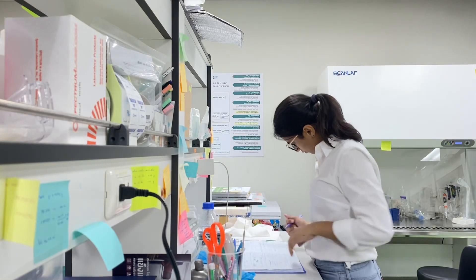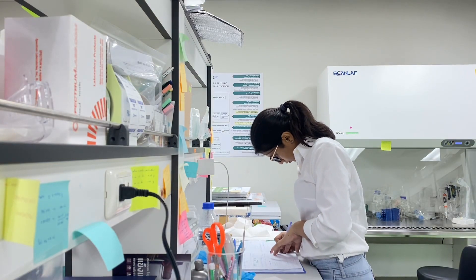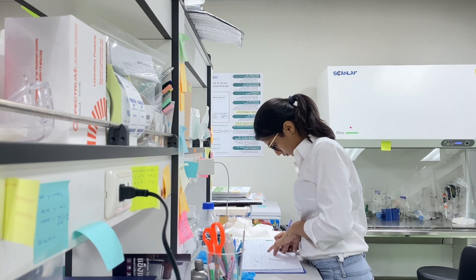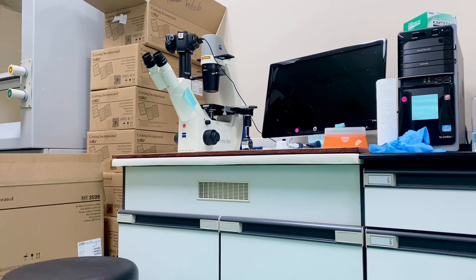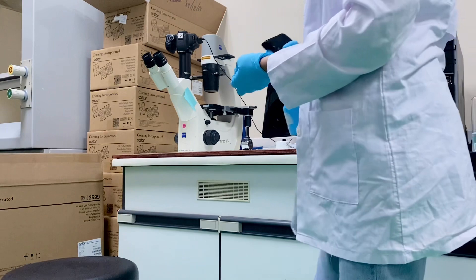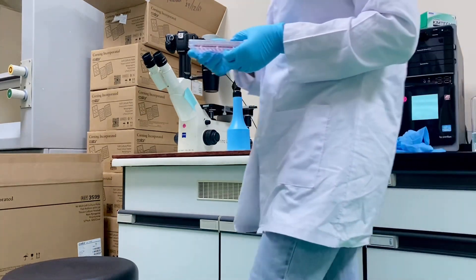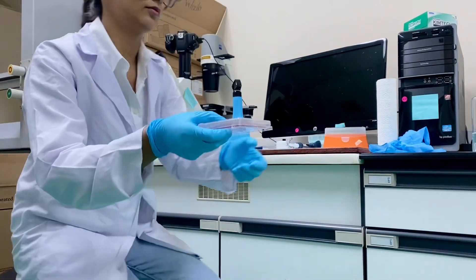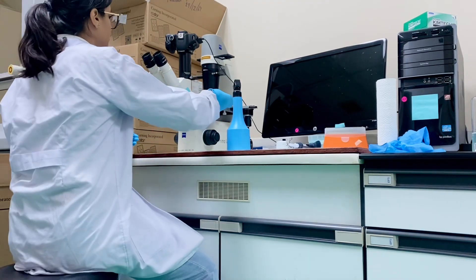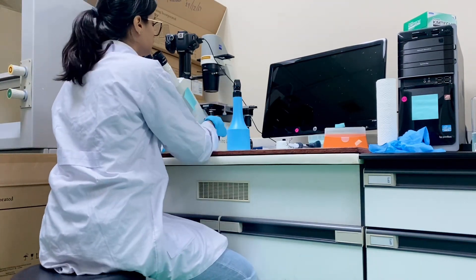Hi everyone, I'm doing some documentation of my experiment. Today I'm doing an MTT assay and I'm on the last step. Before doing anything I always rub alcohol on my gloves so that my plate doesn't get contaminated. I just took out the plate from the incubator and now I'm observing it under the microscope.